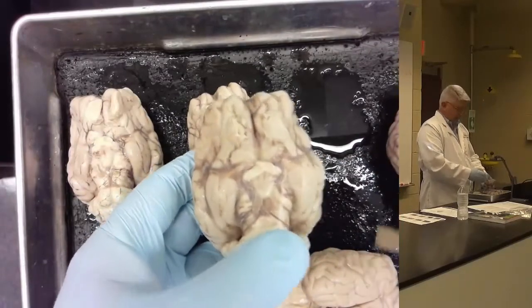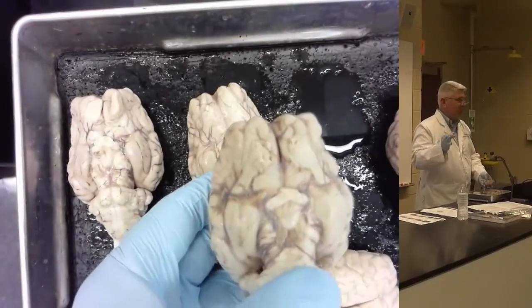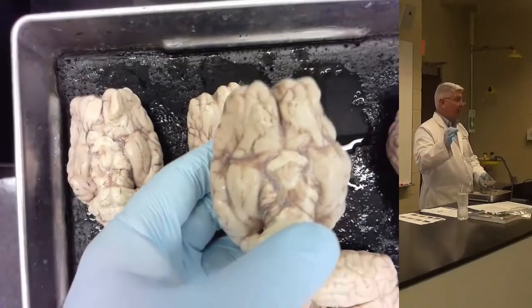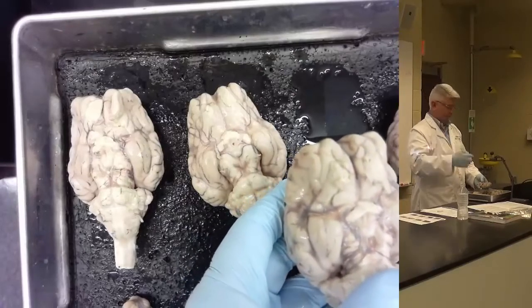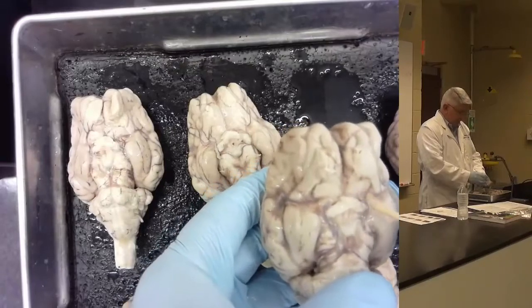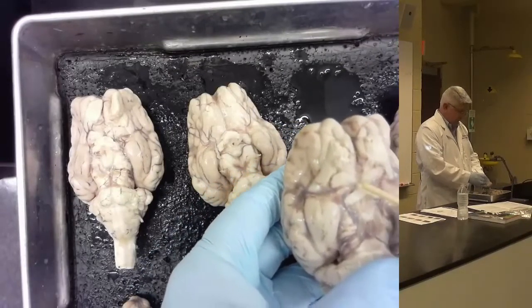Right? I call that the hippocampal gyrus in the sheep because it's on the surface, but it's the hippocampus. But on your answer key for the sheep brain, it'll say gyrus next to it because it's referred to as the hippocampal gyrus. Okay?